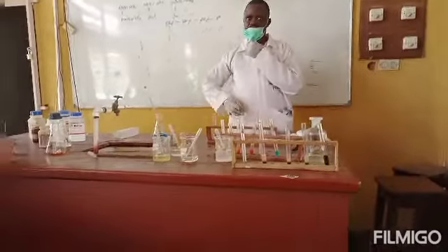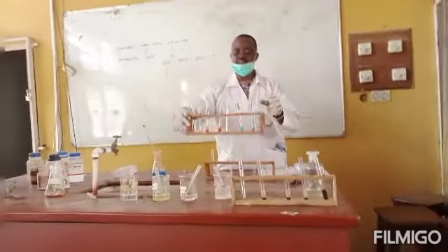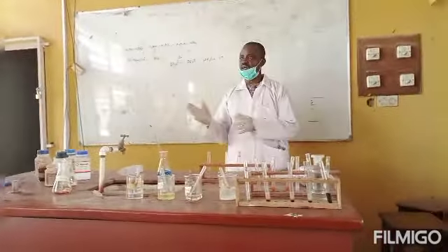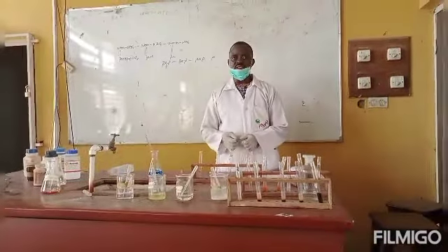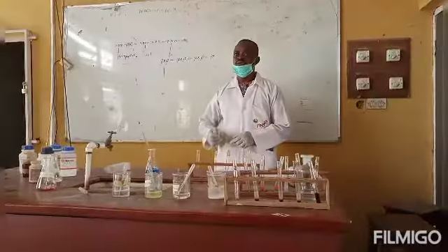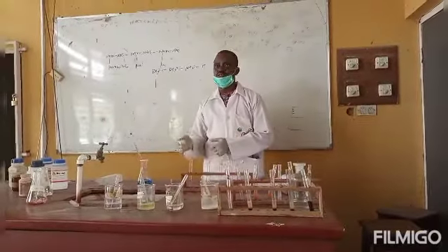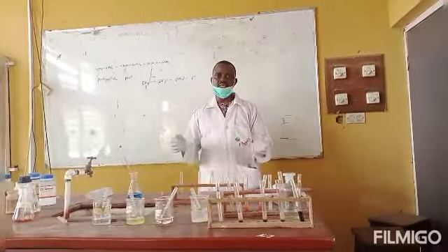We have carried out the Benedict reaction on the 4 carbohydrates that we have available, and we have seen the resultant effects: those that test positive to Benedict and those that test negative. That is, the ones that have the reducing property and the ones that don't. Now, we want to look at the sensitivity of different glucose solutions to the Benedict reaction. What we will do is prepare different dilutions of the glucose solution and test with Benedict reagent and see what will happen.